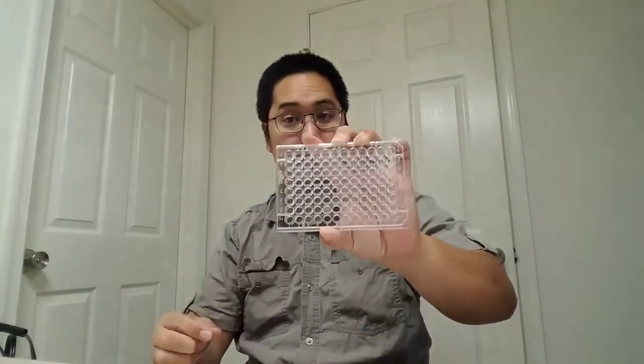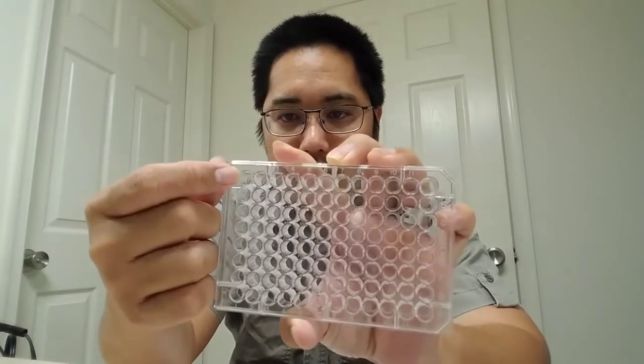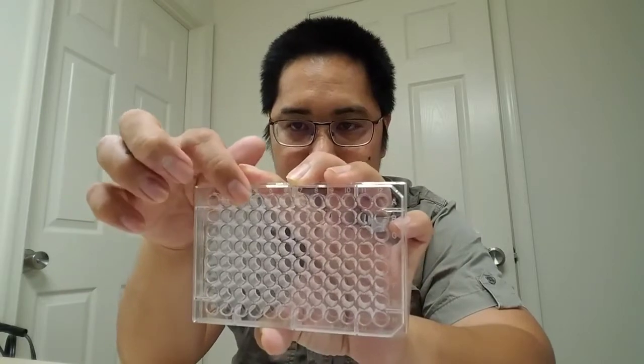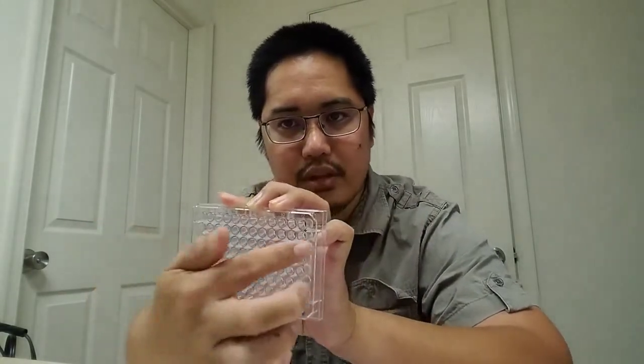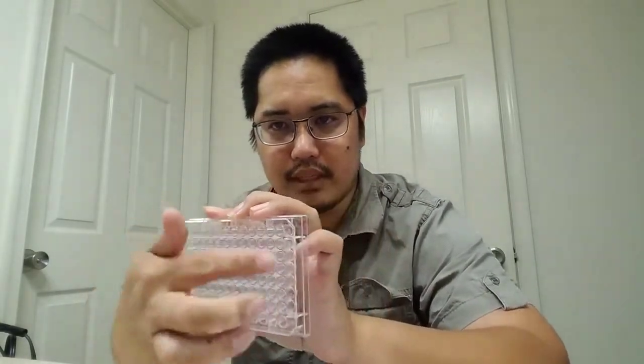Now, what we're going to do is use column 1 in the 96 well reaction plate. So here's column 1, and here's A, B, C, D, E, F, G, and here's column 1, 2, 3, 4, 5, all the way up to 12. We're going to use only column 1, and we're also only going to use column 12, just so that way we don't mix things up.